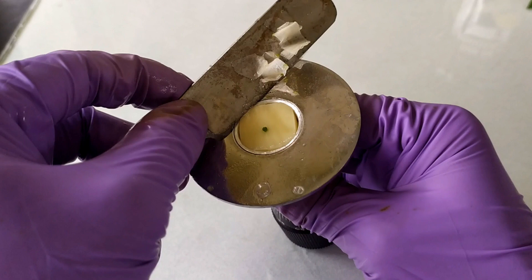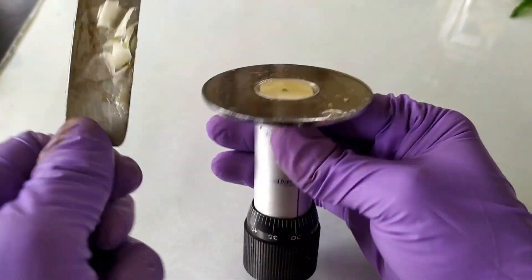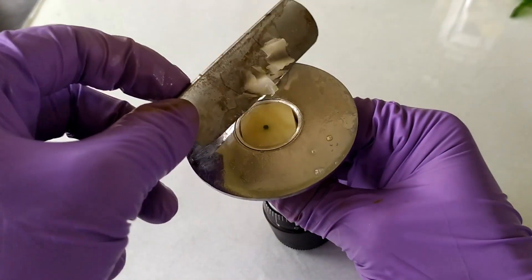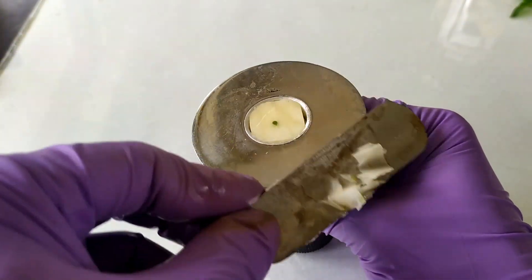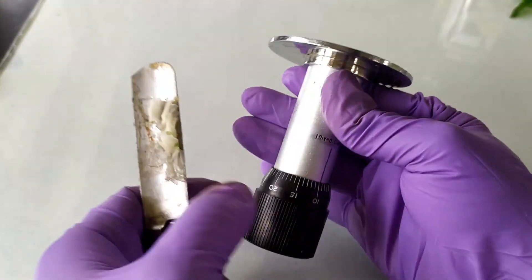Pressing the blade edge firmly against the platform, make one quick stroke across the sample and the pith moving the blade from one corner to the opposite corner like so. Collect the section in a petri dish filled with water. Again rotate the knob to the same thickness used before and then section the sample.